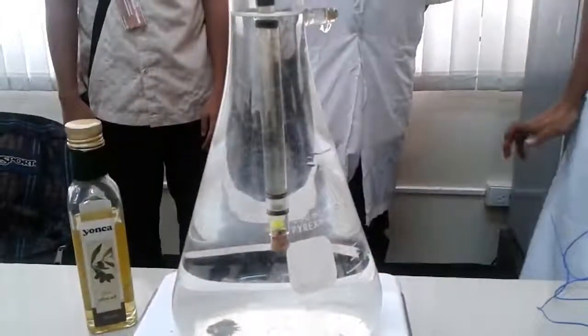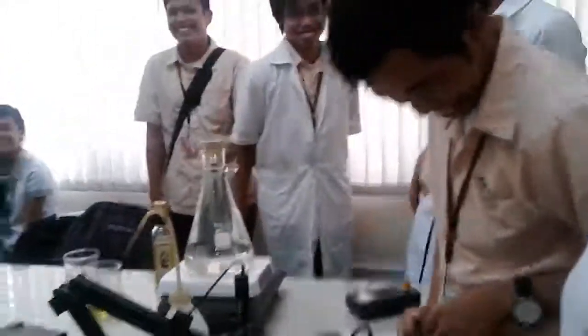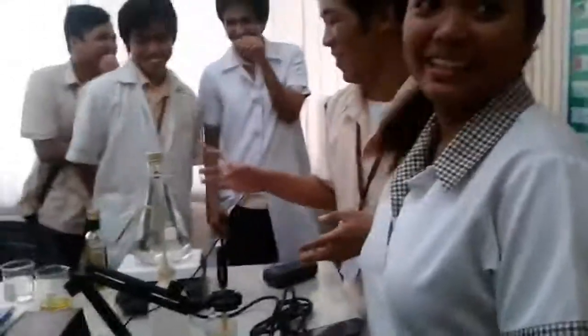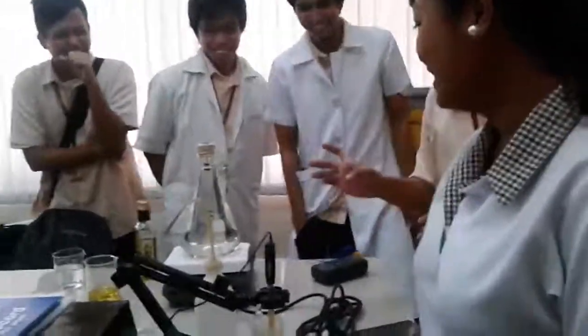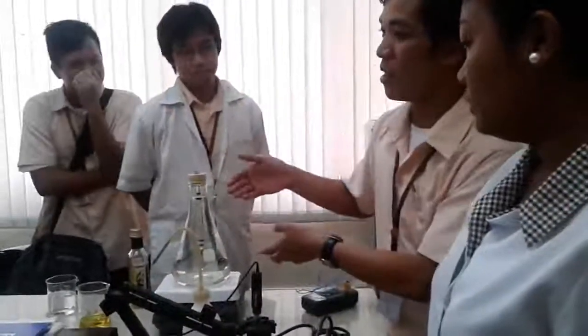Total time 9.34 seconds. So you can see now, the time it took for the pellet balls to travel is 9.34 seconds. That is why we opted for it, so that we could clearly see the ball traveling downwards.